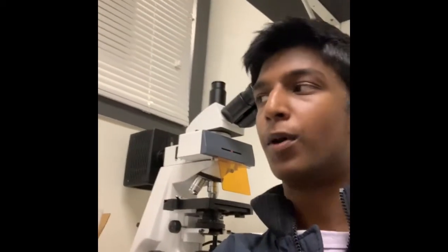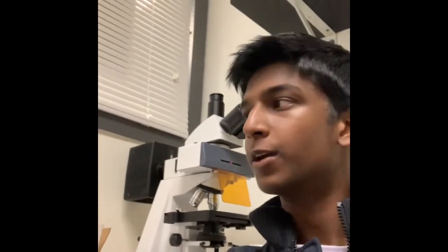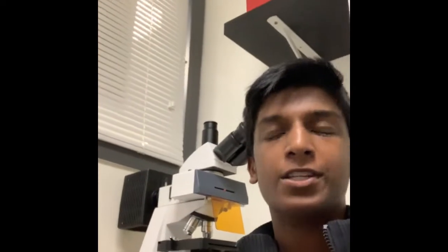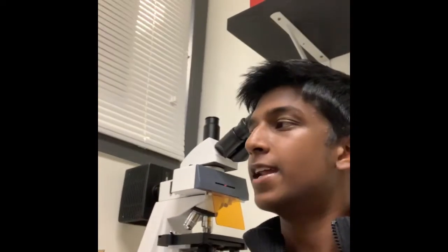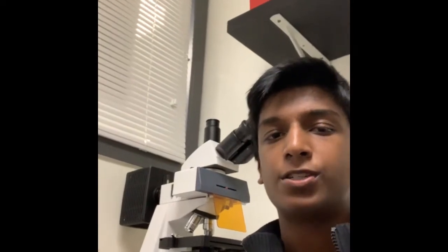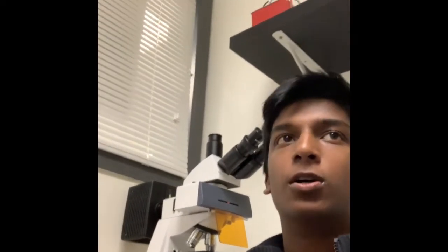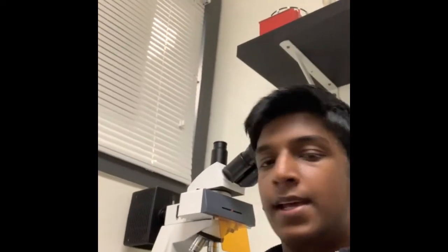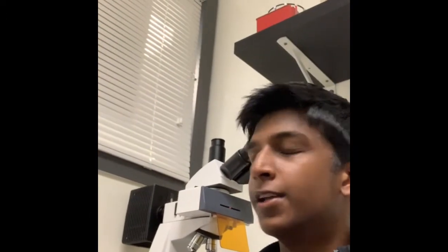Just a quick little side note. There's a separate part of the microscope called scaling, and it requires this special little ruler for scaling your images so you have accurate data. Mr. B has this ruler, so to get the best results I'd recommend talking to him about using this. It's too long to bring up in this video, but it'll really help your results.